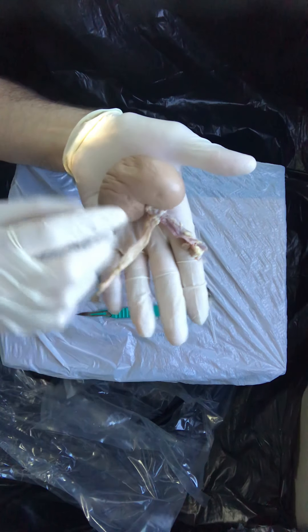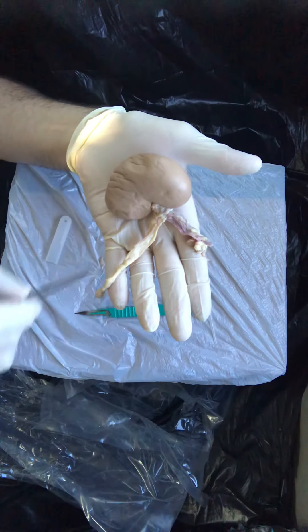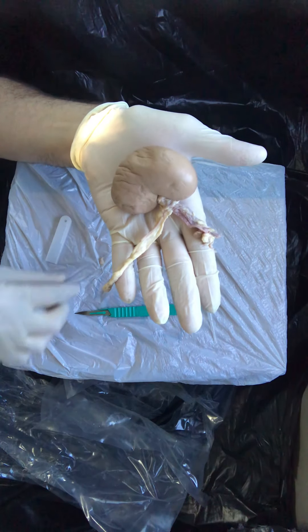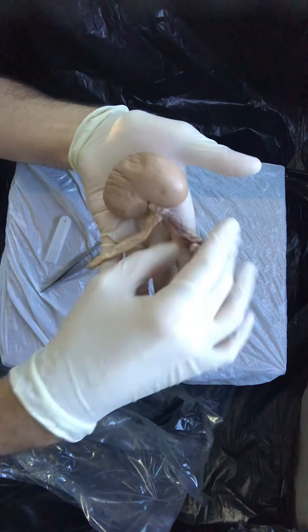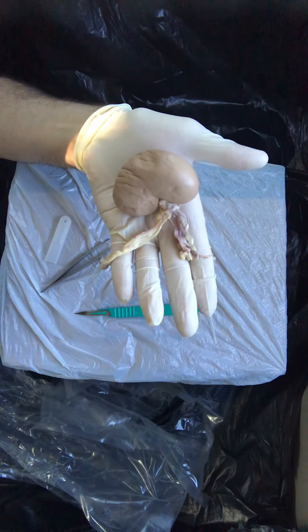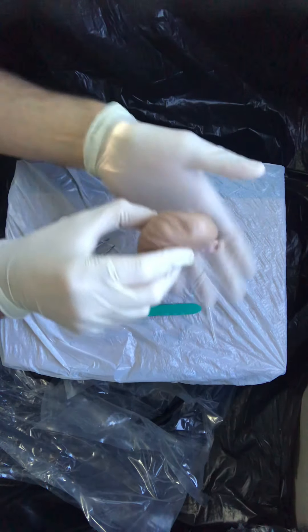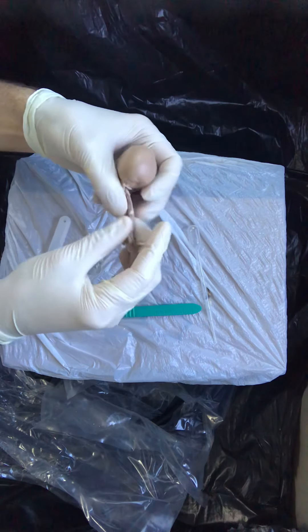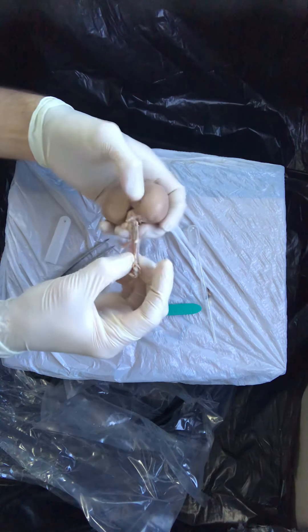Up here these are going to be the vessels. So the ureter, of course, is inferiorly towards the urinary bladder, and the vessels, of course, more or less in a horizontal direction as they come and go from the aorta and the inferior vena cava respectively.